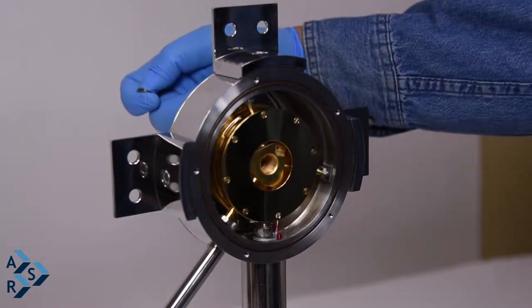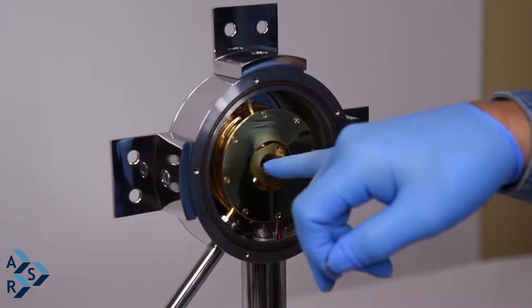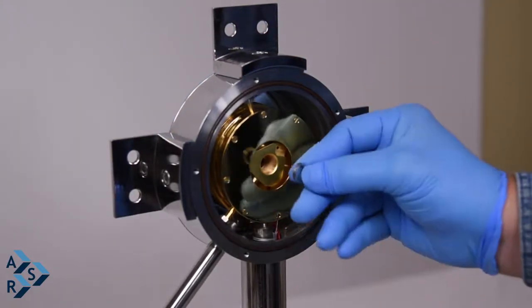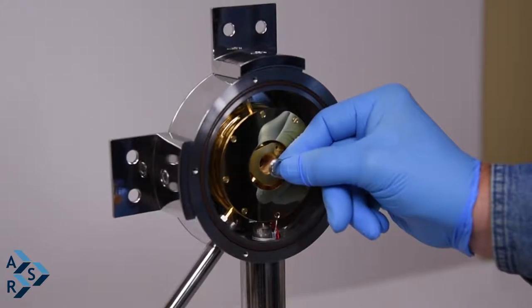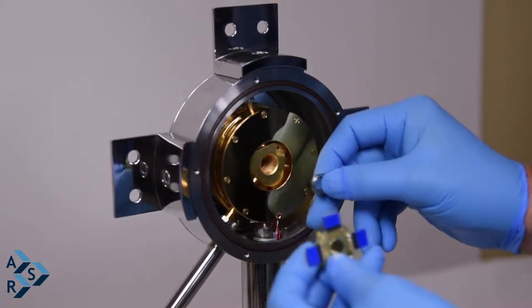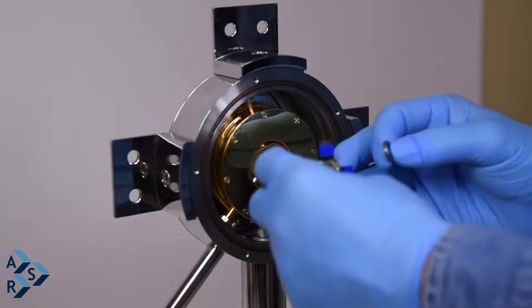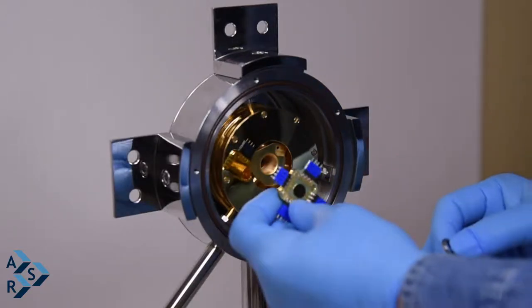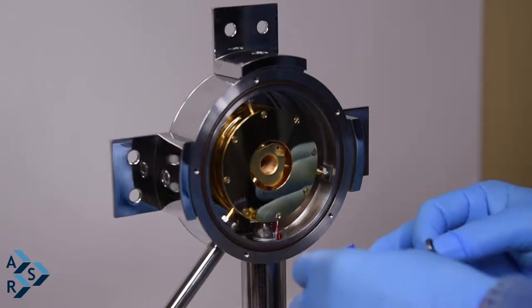You could actually have access from the rear or from the front. So you could go in from the front like this, adjust your height for when you turn this in. This helps hold your sample in place and will help with vibration and some drifting.